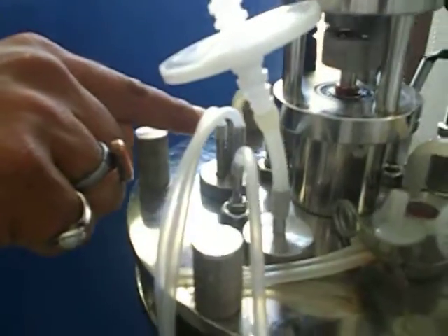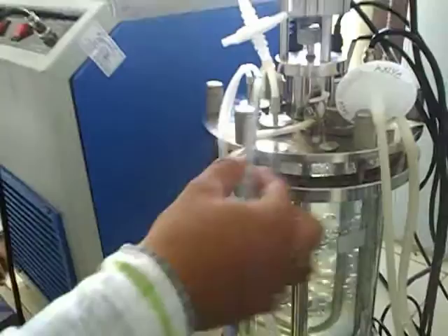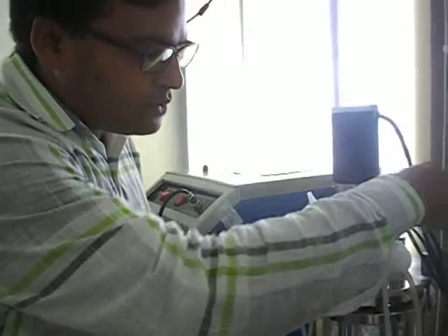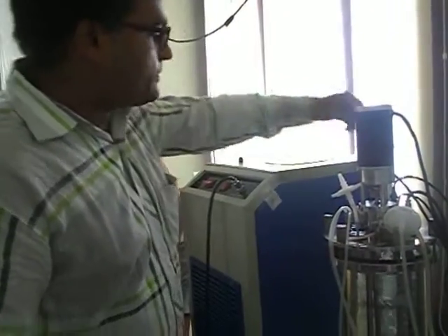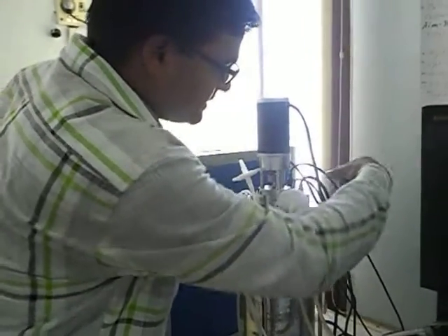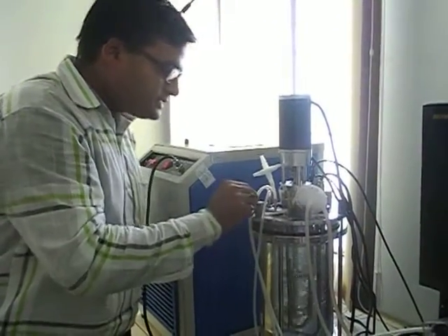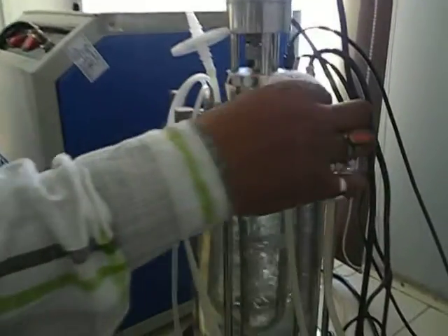For adding acid, base, and anti-foam pump. This is the sample port — you can add the sample from here. This is the port for acid, and the port for the pH/DO sensor. This is the PT100 sensor — for the heater temperature sensor. And due to the heat exchanger, there is cold water circulation.